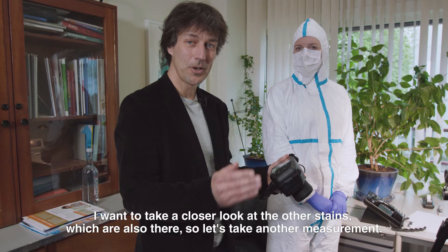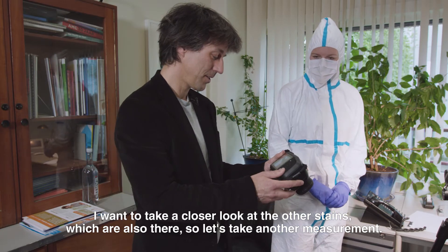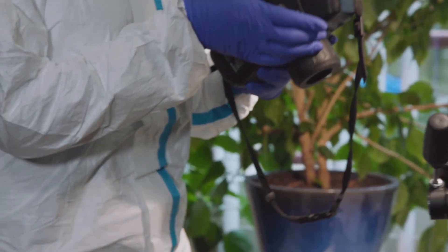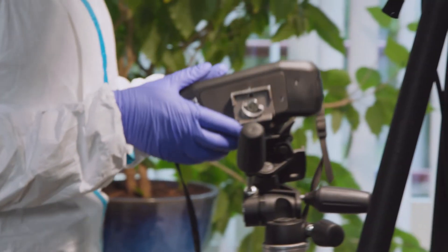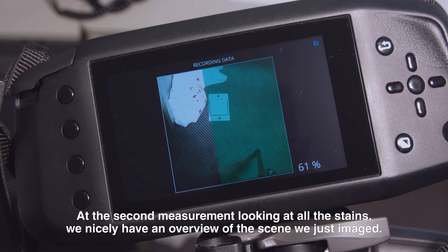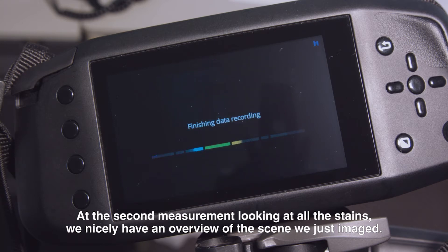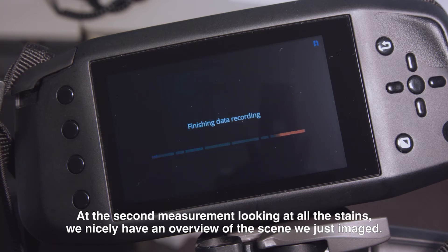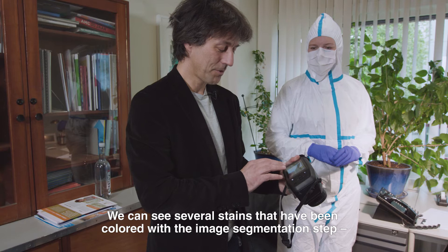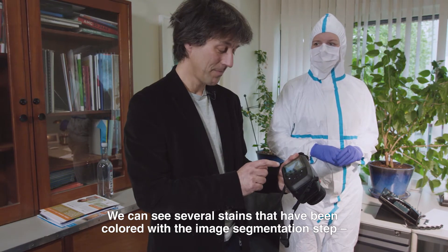But I want to take a closer look at the other stains which are also there, so let's take another measurement. We've done a second measurement looking at all the stains. We nicely have an overview of the scene that we've just imaged. We can see the several stains — they've been coloured. There's an image segmentation step here.